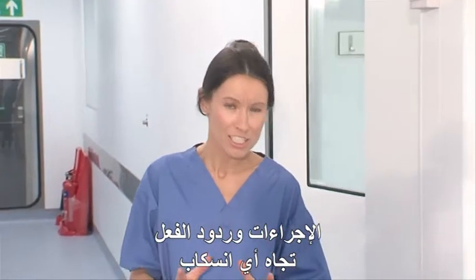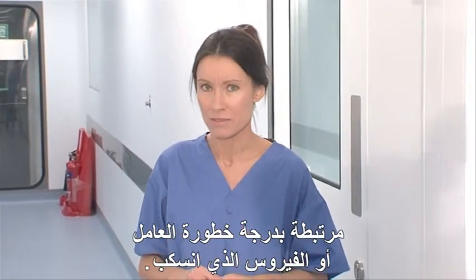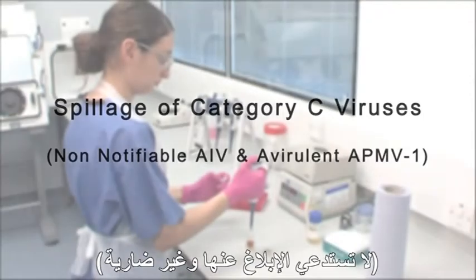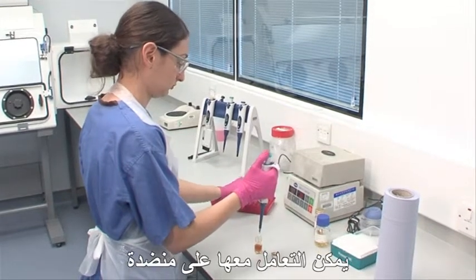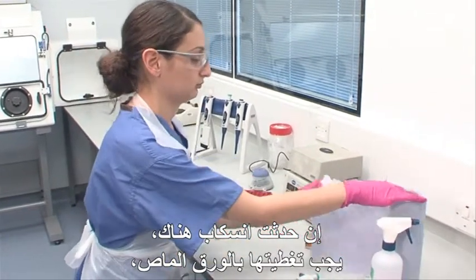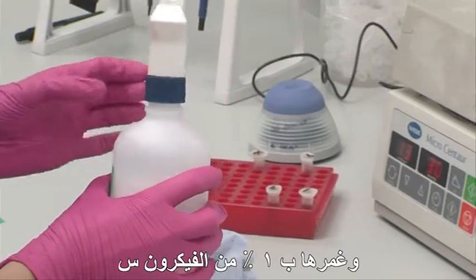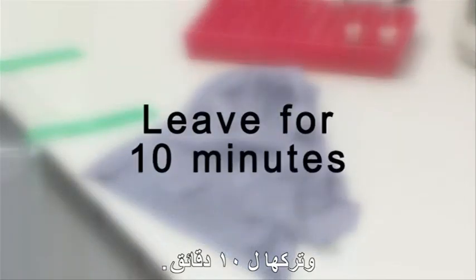The procedures and reactions to any spill will depend on the risk level of the agent or the virus that is spilt. Under certain circumstances, some Category C viruses can be worked with on a bench. If a spillage occurs here, it should be covered with absorbent paper, flooded with 1% Virkon S, and left for 10 minutes.